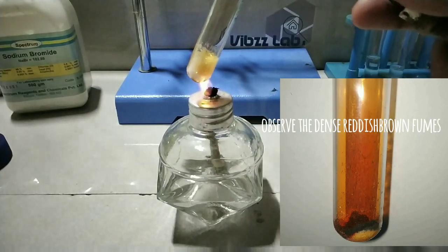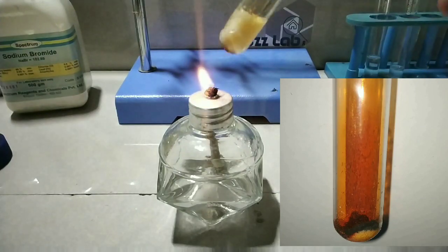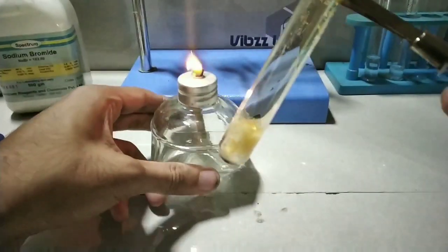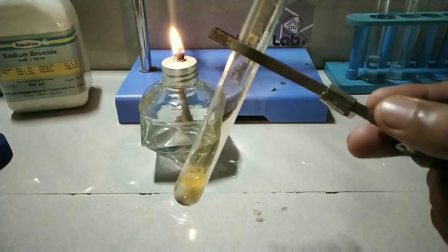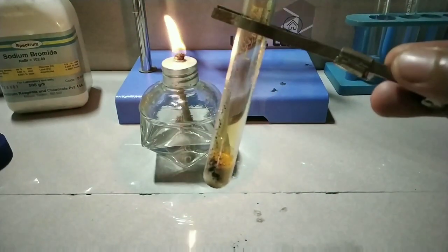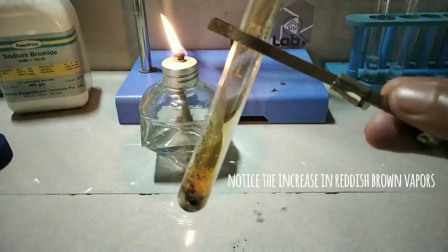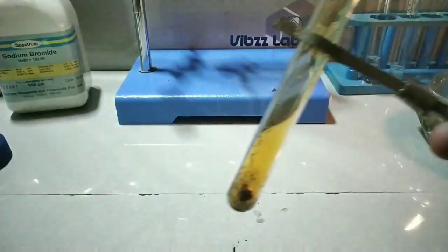On heating the test tube, the inset video is showing a lot of reddish brown fumes, and in the main video you can see that there are brownish colored fumes being produced, but it's not very obvious. So now we will be adding a pinch of manganese dioxide, which is acting as a catalyst to speed up the reaction. After adding the manganese dioxide, the brown colored fumes are now very evident, which means the reaction has taken place much faster.